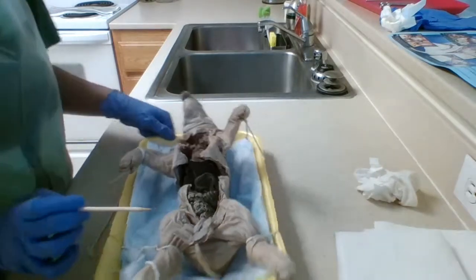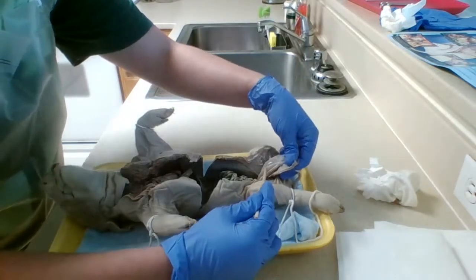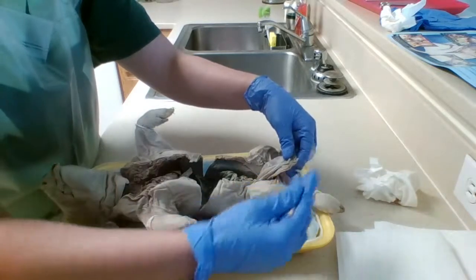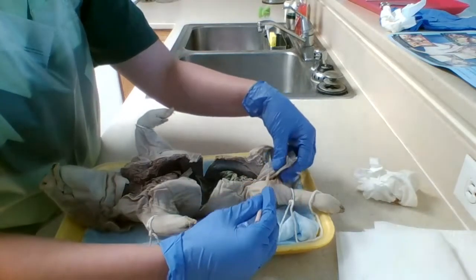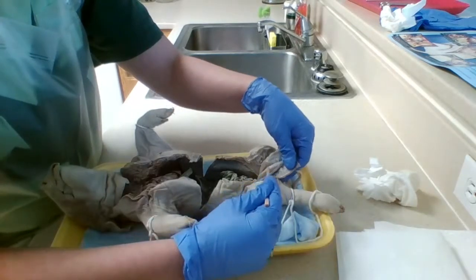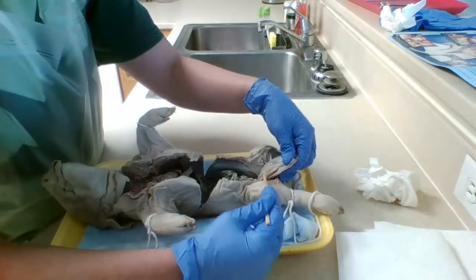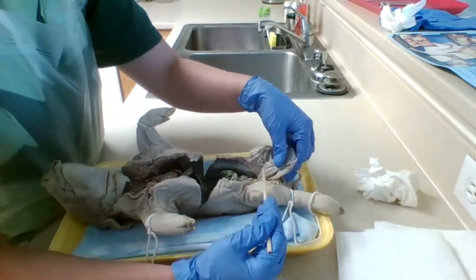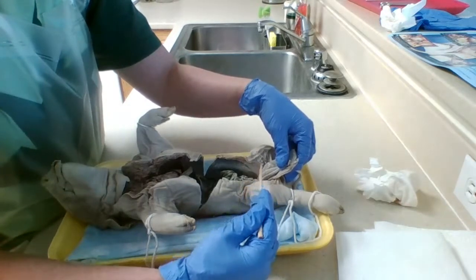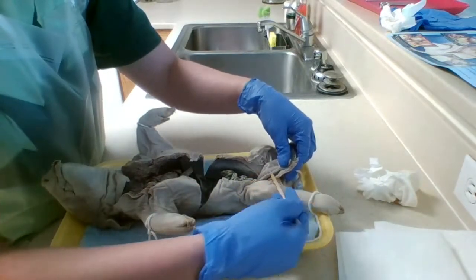Next I'm going to show you the urinary bladder. And that is going to be right here. This is the urinary bladder, and it's a muscle, a sac that stores urine before it's released. And just next to it on either side are 2 little structures right here that are the umbilical arteries. Those are vessels that transport deoxygenated blood away from the fetus to the placenta during the formation of the fetal pig.